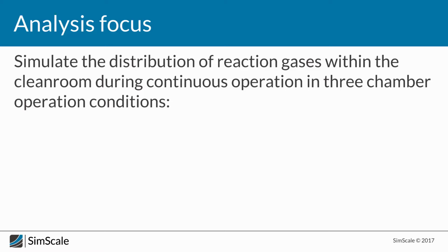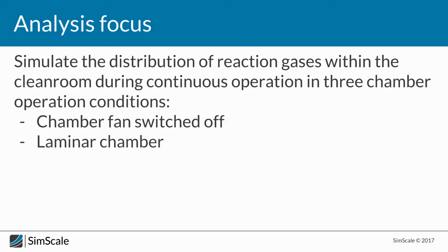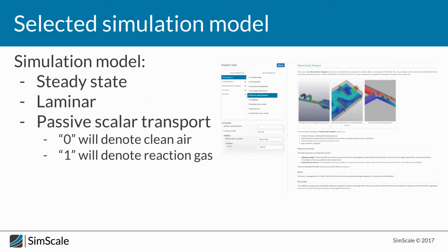In this case, we have the three operation conditions. We'll switch off the hood and the fan that is positioned at the top of the reaction chamber. We'll operate the chamber in a laminar way, trying to blow out all the contaminants and the resulting reaction agents. And finally, we'll take a look at different suction chamber conditions, trying to estimate what should be the minimum speed of operation for our chamber in order to not pose any threat to our operator.